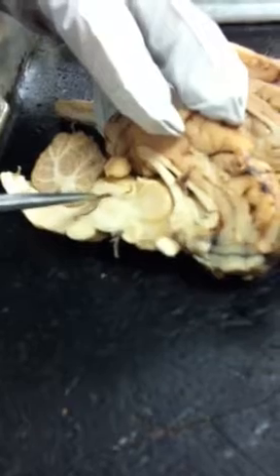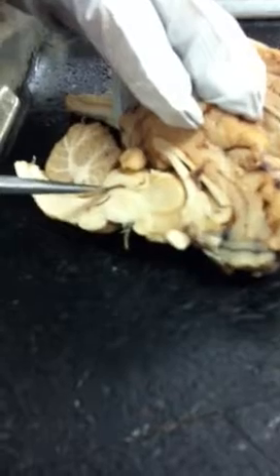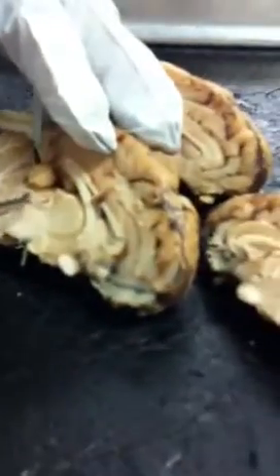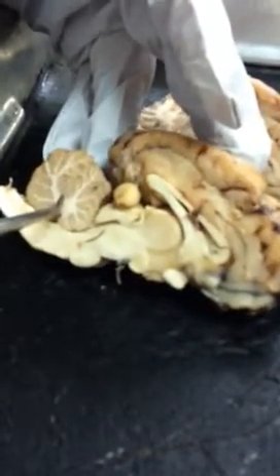I think on your model, we can see it better. So this area here, if this would be the thalamus and this epithalamus, this area here would be the cerebral aqueduct, and this would be the, what's that T word? It's part of the epithalamus. Tectum. The tectum. And that's the back wall, the dorsal part of the aqueduct. This is the cerebellum.